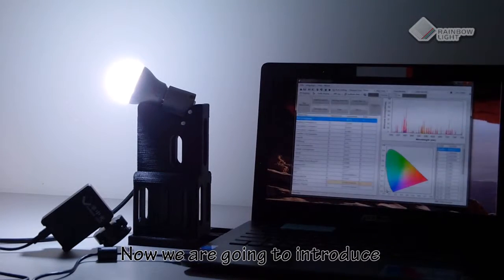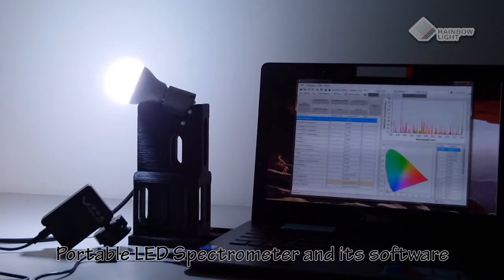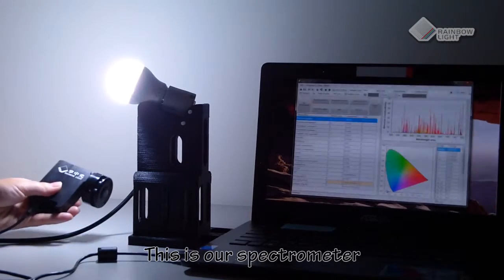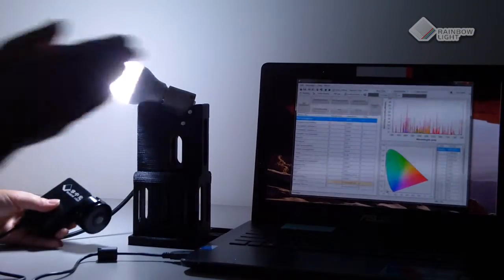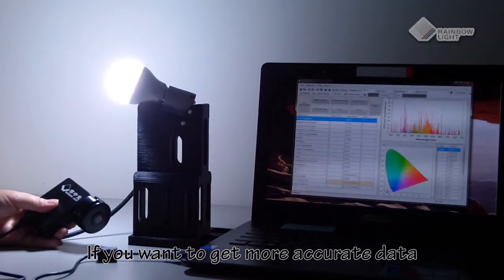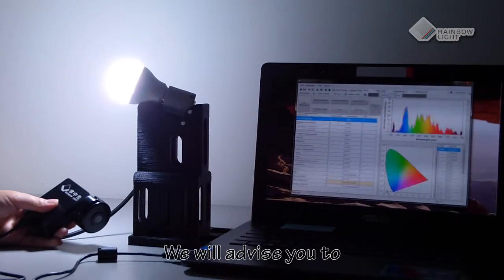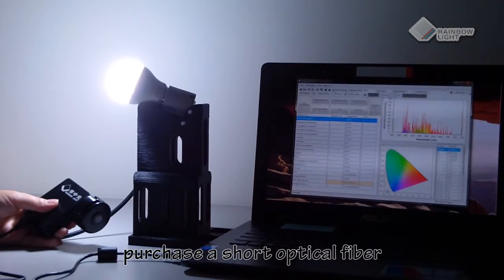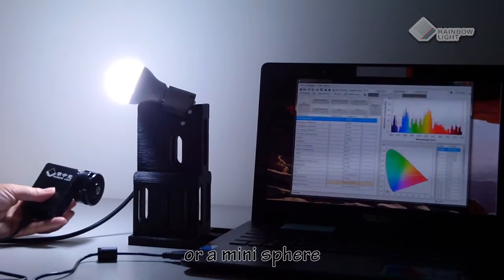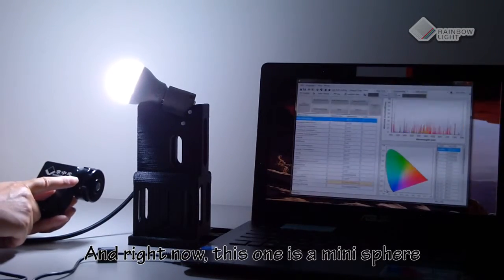Now we are going to introduce the portable LED spectrometer and its software. This is our spectrometer and that is our software. If you want to get more accurate data, we advise you to purchase a short optical fiber or a mini sphere. Right now we are demonstrating with a mini sphere.